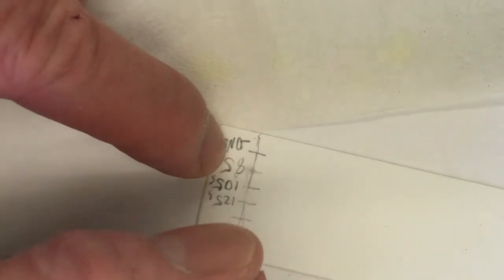Okay, and I've got to get a new capillary tube. I broke that one down too much. Now I'll go back and do the next one. It says 85 seconds. Let's see what it actually is. I'll drain, drain, drain, and let's spot it. I have it on camera. There it is. Pretty good, huh? Let me move it here. Okay. So now when I spot it, 1, 2, boom. That was at 3 minutes, 20 seconds.